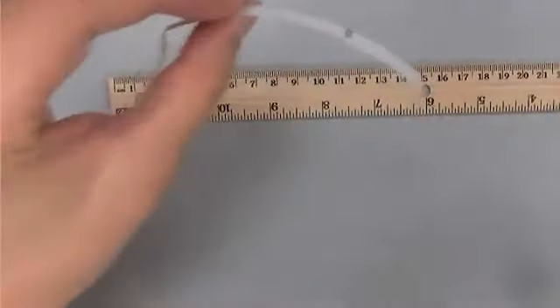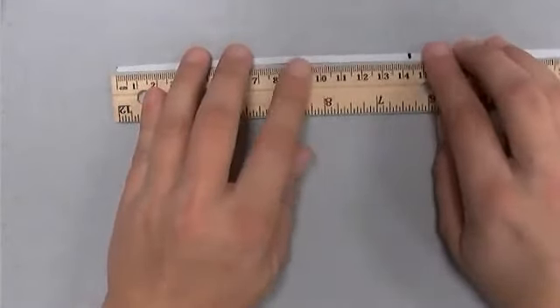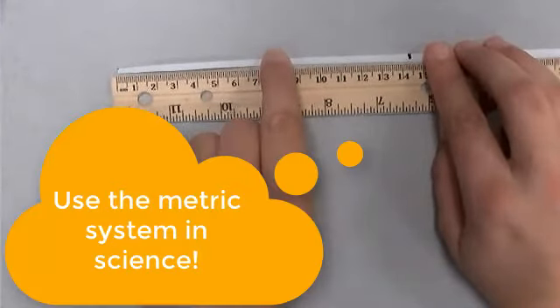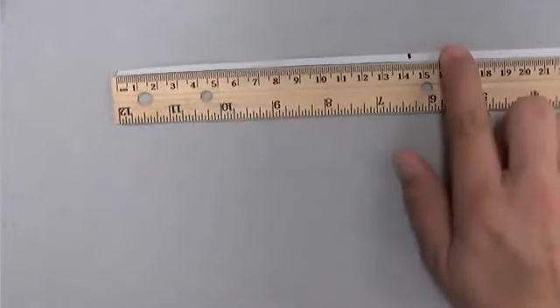And then we're going to measure the distance from the end to the mark. Now, we are measuring using the centimeter side of this ruler because we are participating in science, and science uses the metric system. So we're not using the inches side, we're using the centimeter side.